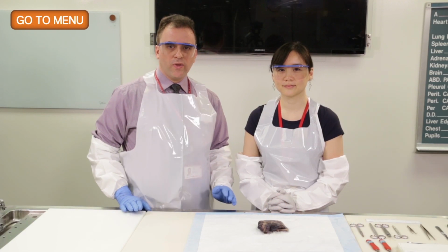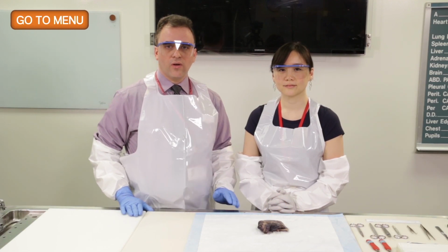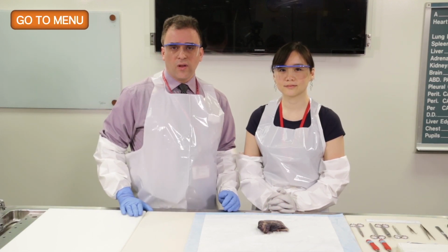Hello. Today we'll be discussing the evaluation of gross pathology of lung cancer.